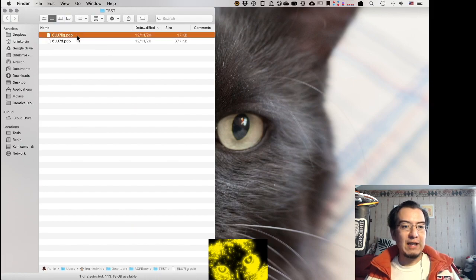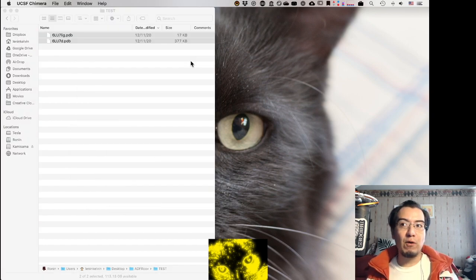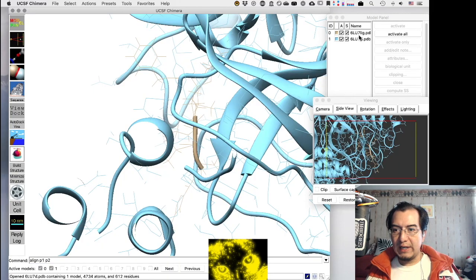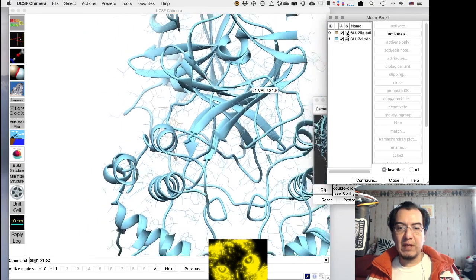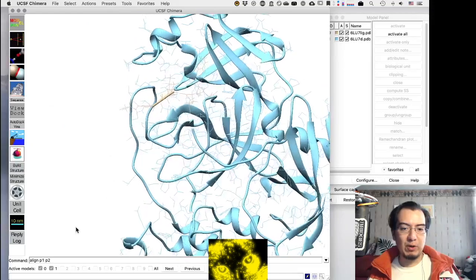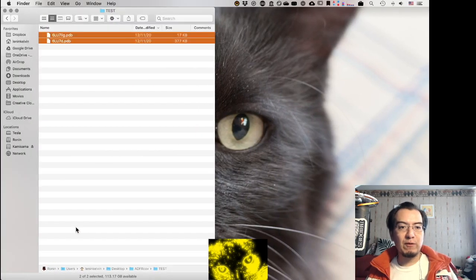So here are my files. I can probably open them on Chimera, UCSF Chimera, my favorite default program for looking at structures. There should be two entries here. Yes, one is the ligand, because it's a peptide, it's displayed here as this ribbon, and the structure. So clearly, because this structure and many other structures have been so important for the past year, we know the binding site. However, I'm going to try to cover this tutorial from the point of view of not really knowing where it is, and picking a binding site from scratch.